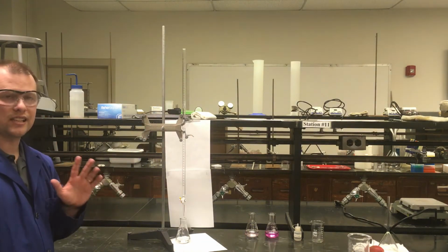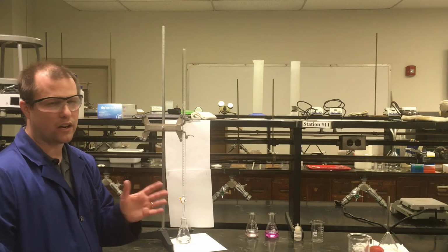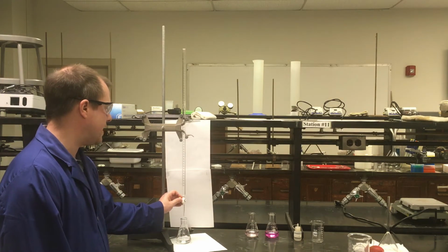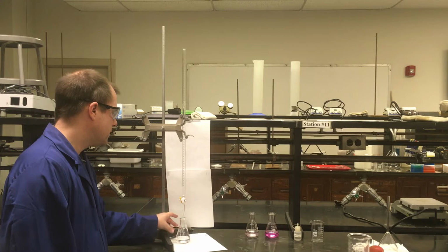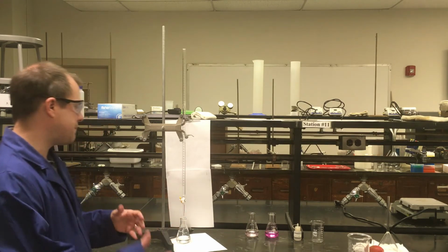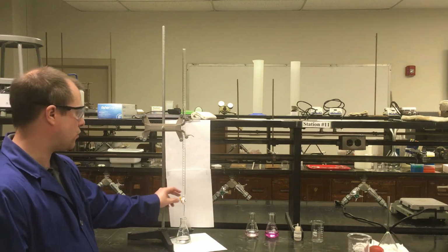In my case, since I do know about the volume I'm going to need to add, I'm going to speed this up a little bit. So I started at 16 milliliters. If I need about 24-ish to get to my equivalence point, I'm going to add pretty quickly down to about 36. And as I add, one of the things you really should be doing is mixing your solution well, because that keeps everything even throughout and keeps pretty constant concentrations everywhere. The other thing you're going to notice is you're starting to see more and more pink color form.